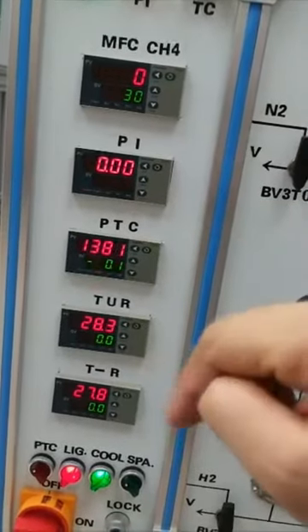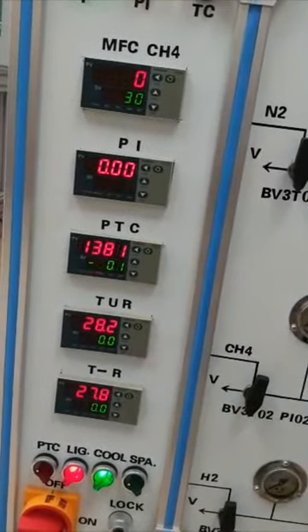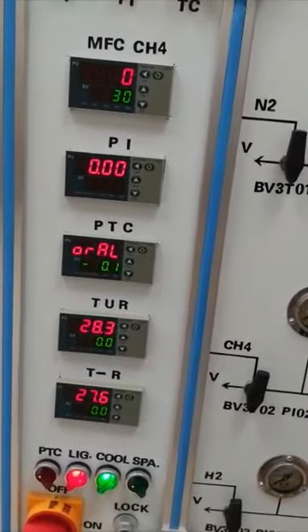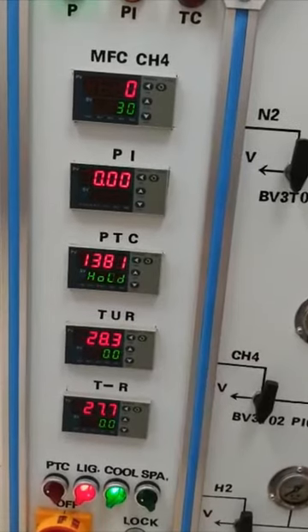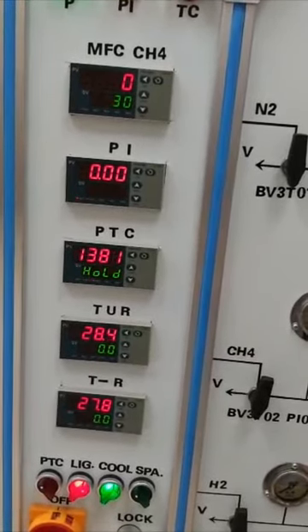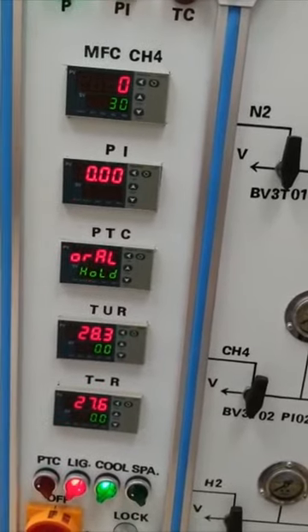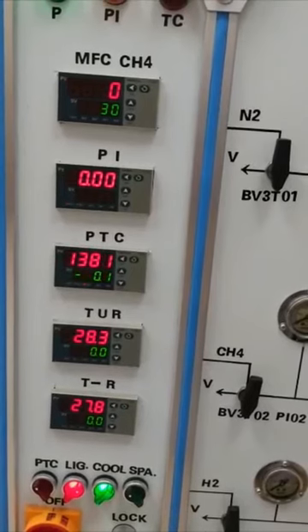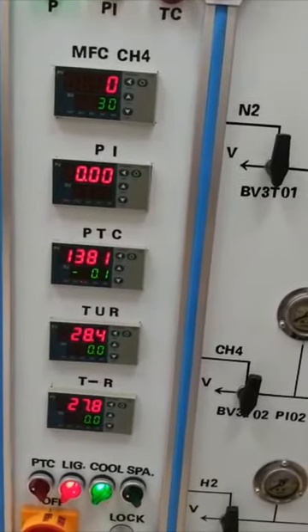Initially this system was designed for optical methane reforming, but based on the limitation of this reaction, it may not have that high activity, because there is scarcely any research conducted under this condition.